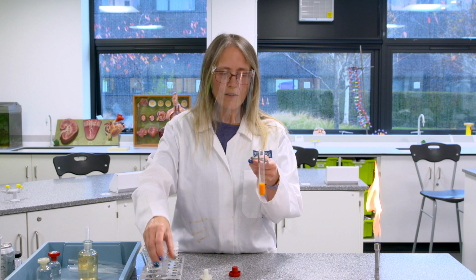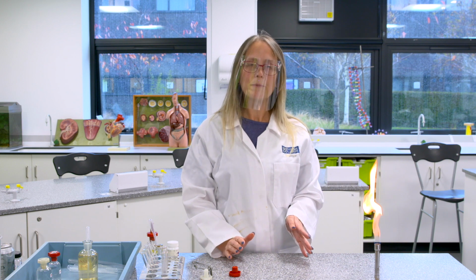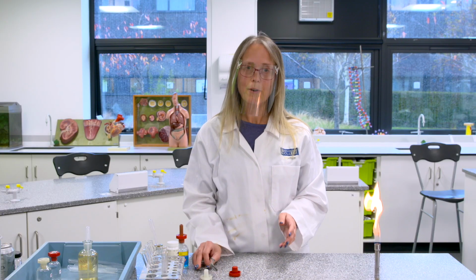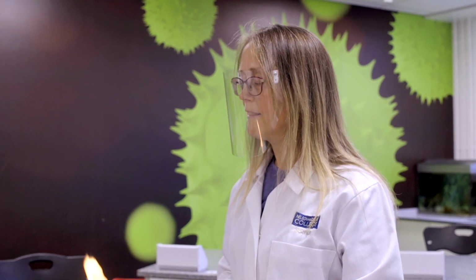Okay? So that is something that midwives used to have to do in people's homes in the olden days. So midwives would go around to people's houses for pregnant women, and they needed to test their urine, because one of the problems people can get in pregnancy is what we call gestational diabetes. That means that they end up with sugar in their urine, and it's a bad sign. It means that something's gone wrong. So midwives used to have to take with them a little bottle of Benedict, test tube holders, and a little portable camping stove type of thing, or use the gas stove in the person's house, and test the urine sample for sugar in the person's house.